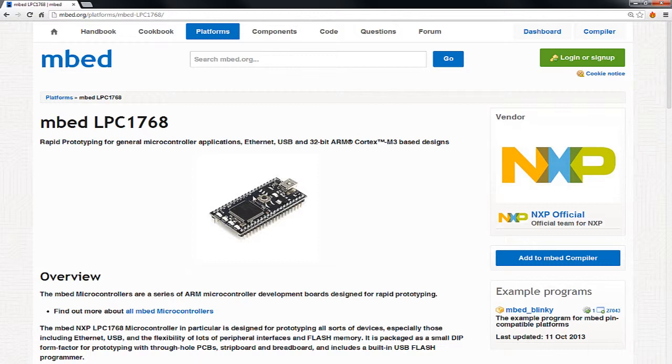The first thing you should do before anything else, and you can pause the video here, is take one of the Mbeds that come with the Chem control boxes, plug it in, and register. You can even plug an Mbed in without it being in the Chem box, just to play around with it, but you have to register to get to the compiler. So let's take a quick look at what happens when we plug it in.